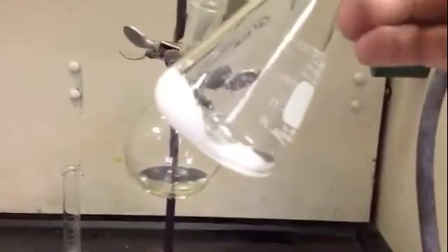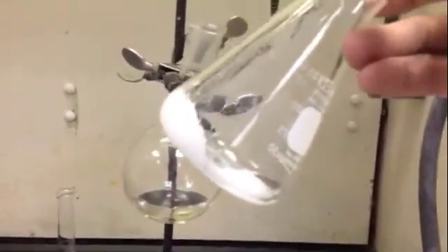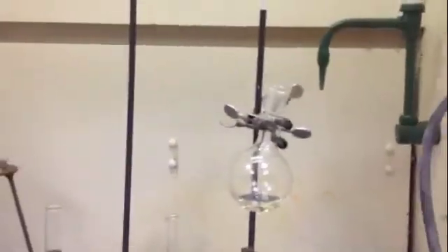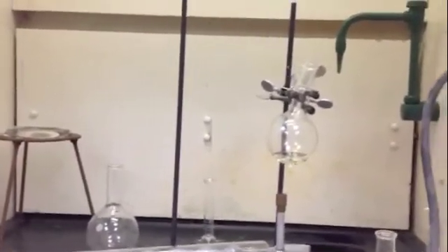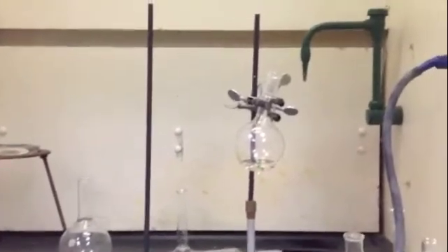What I did next was I used some sodium sulfate to pull the extra water out. And now my ester is in the bottom of this flask. I set up a distillation apparatus to distill that off, and that will give me my final product. Quite a few steps to get here, but we've turned butyric acid - which smelled really bad - into something that smells pretty good.